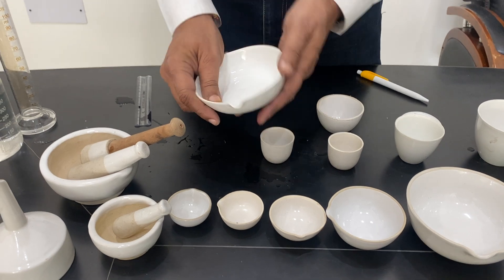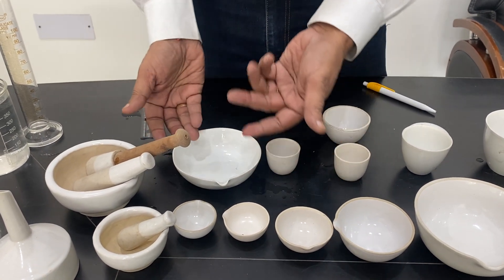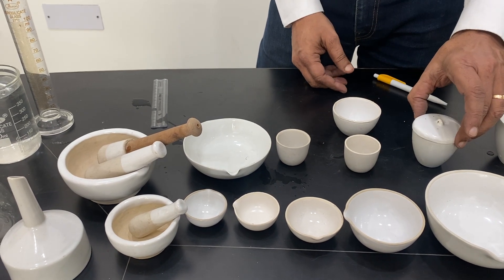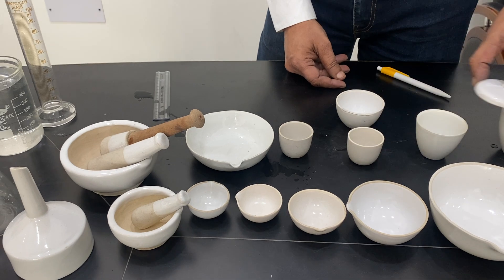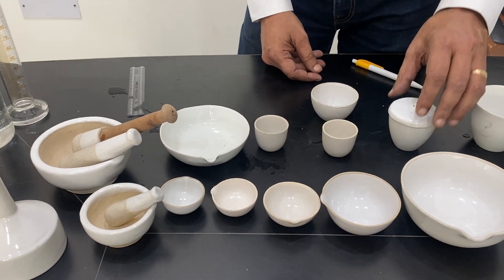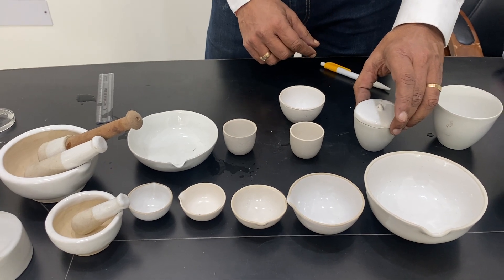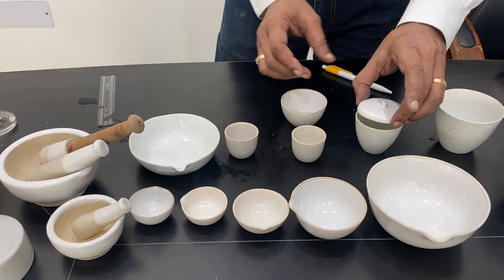This is for pouring and keeping the solution stable. Another product that comes with china is a crucible lid. Sometimes it is a bigger one, sometimes a smaller one. It has a hole to lift it. Sometimes it may fit inside; a little size variation can be there.